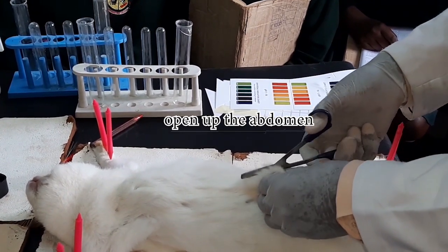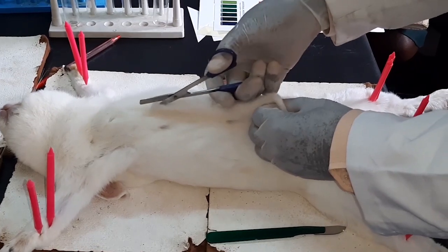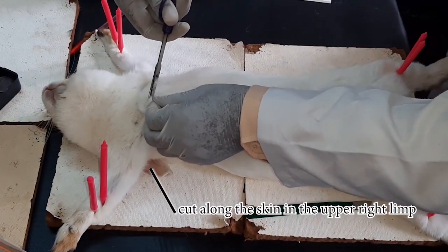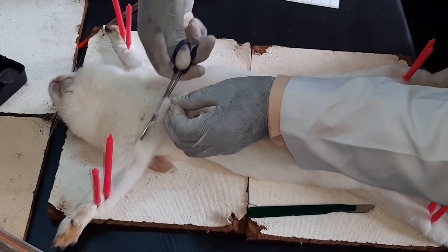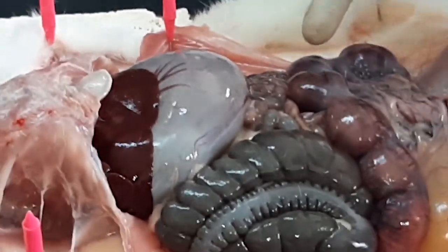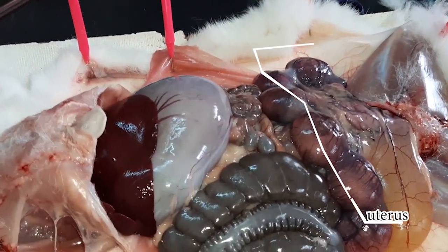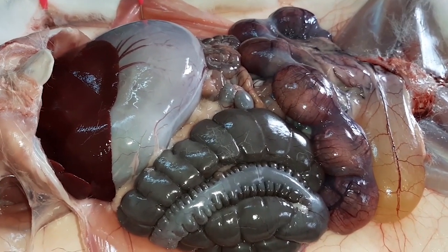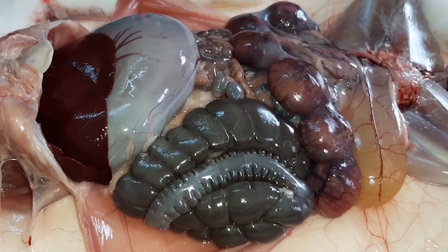The purpose of this video is to dissect a mammalian lung so as to reveal the parts attacked by the SARS-CoV-2 responsible for COVID-19. This video will assist class 7 and 8 pupils and high school biology students to understand the anatomy of the lungs. Science and biology teachers, Bachelor of Science biology undergraduate students, and the general public will find this video quite helpful.